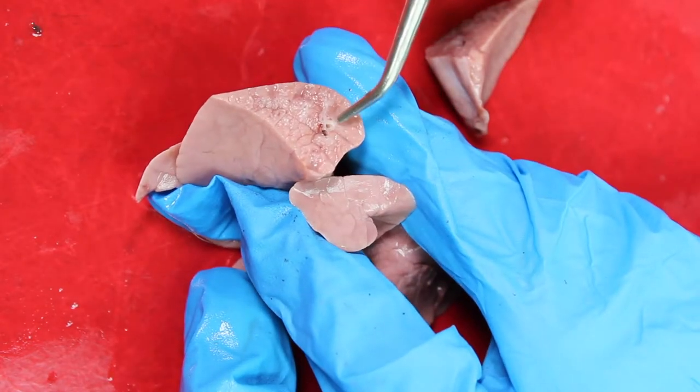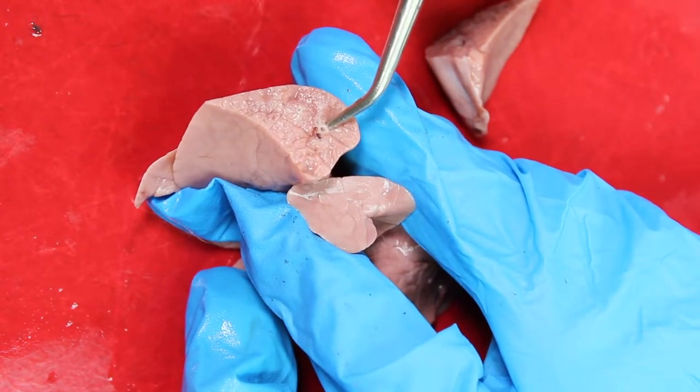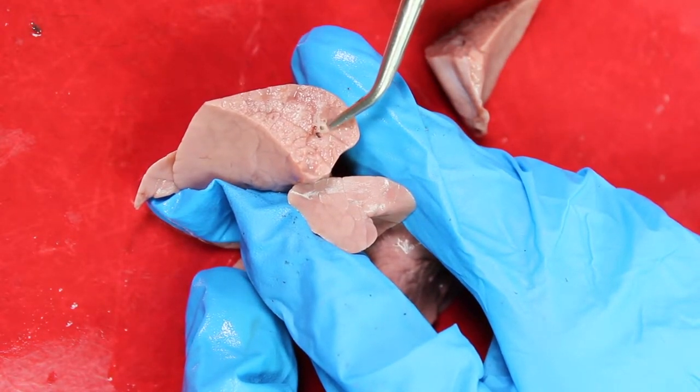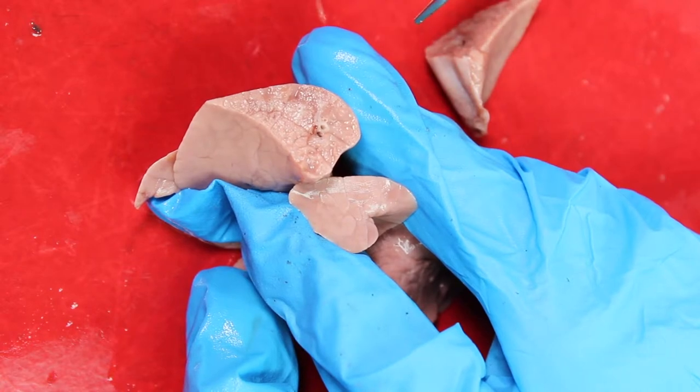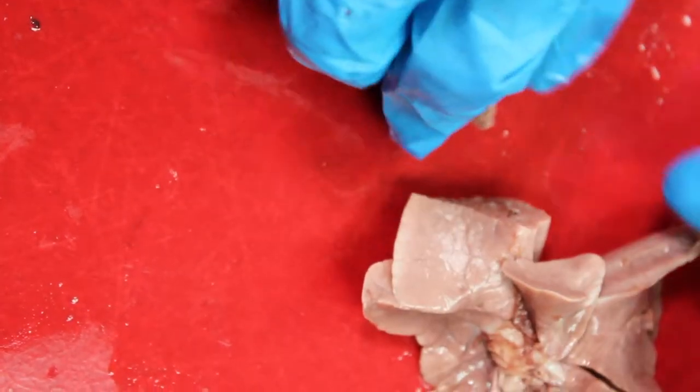All of the lower respiratory tract, including the trachea, bronchi, and bronchioles, is lined with respiratory epithelium.